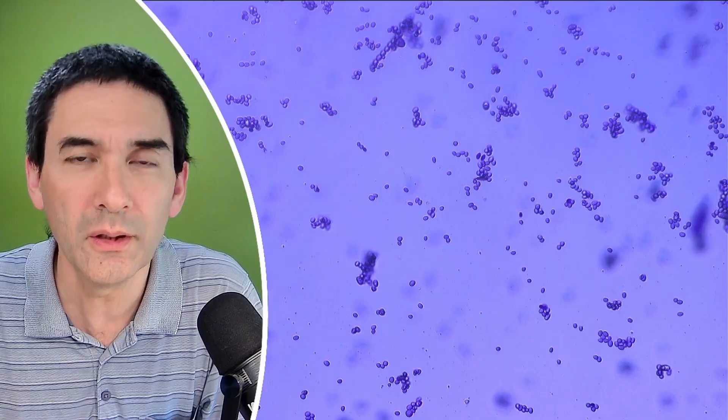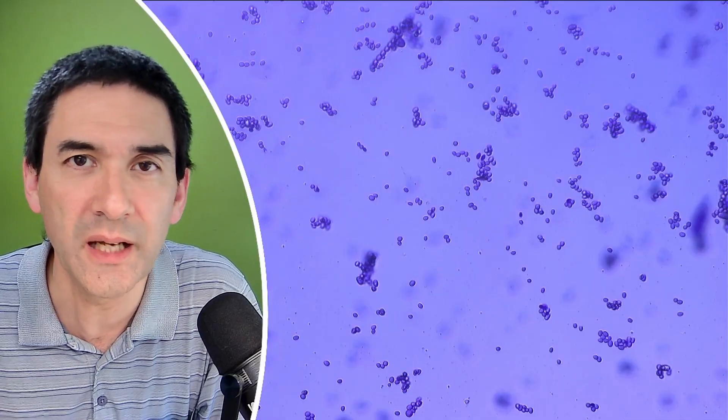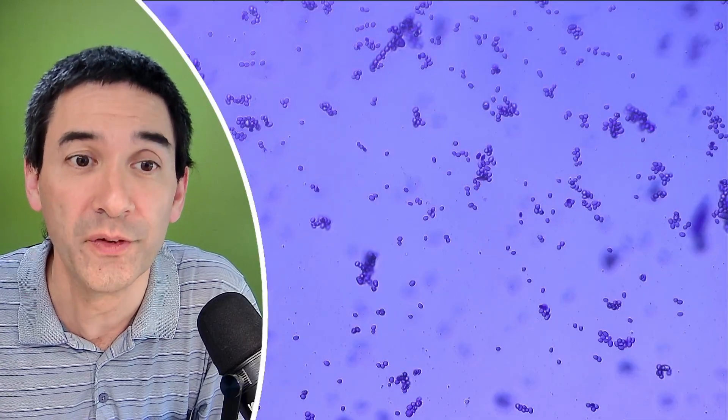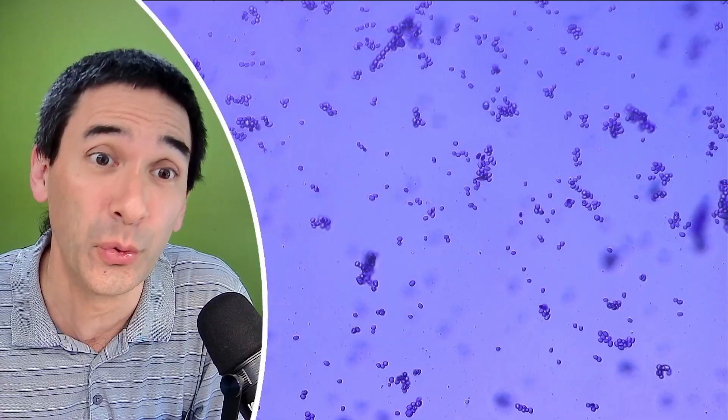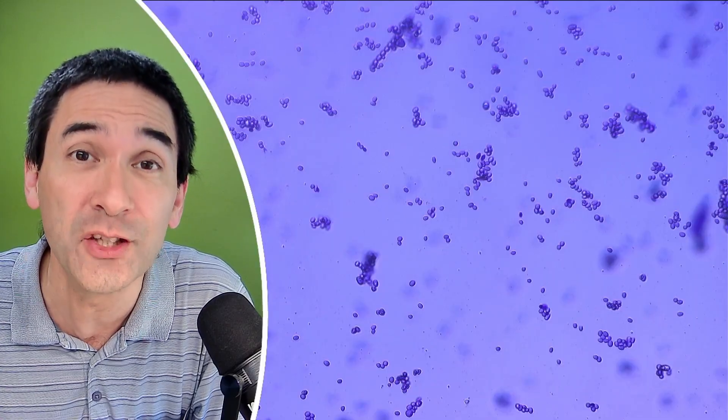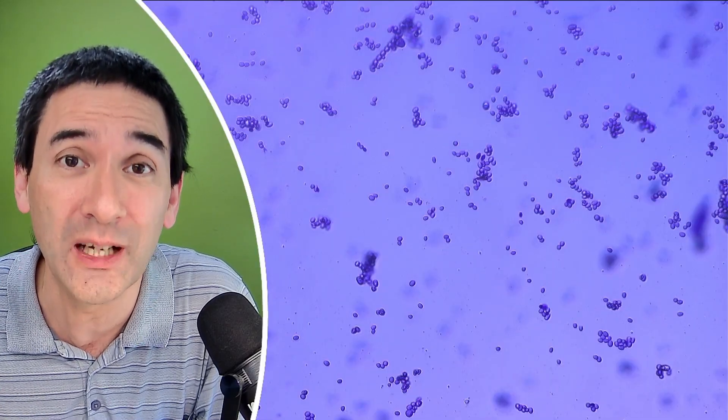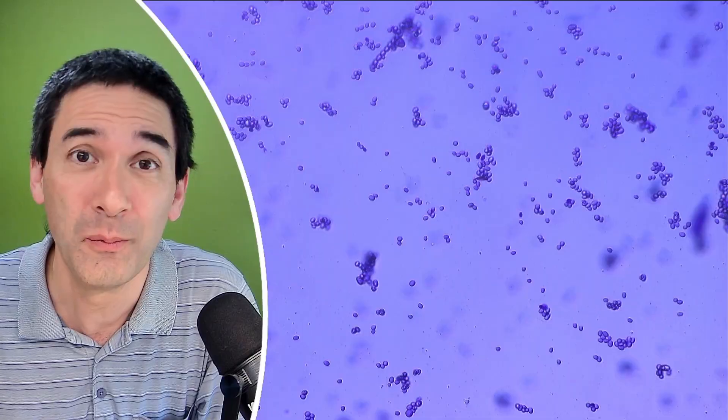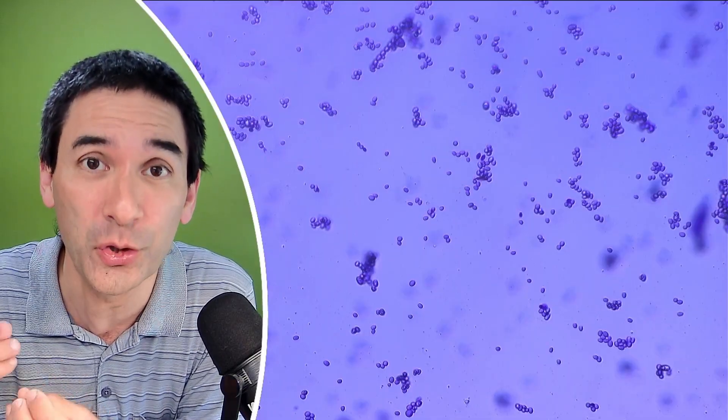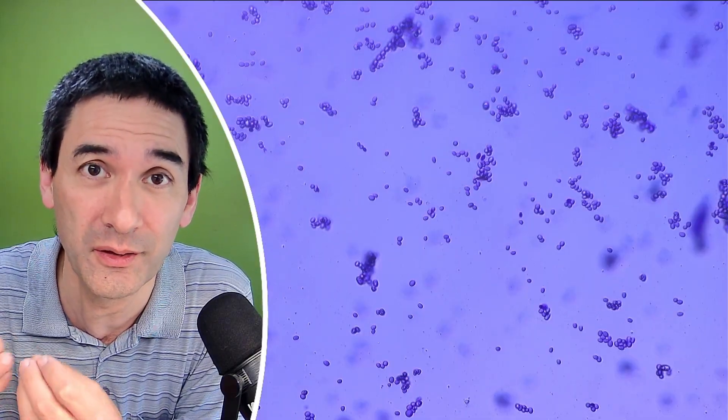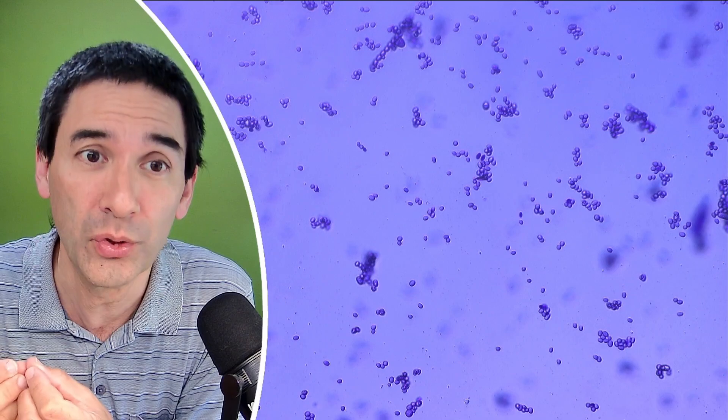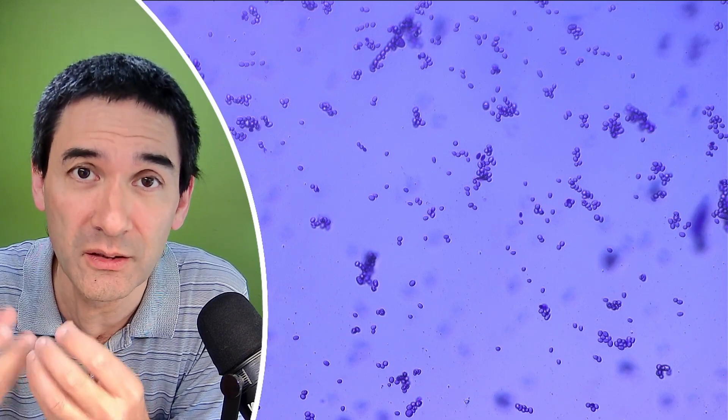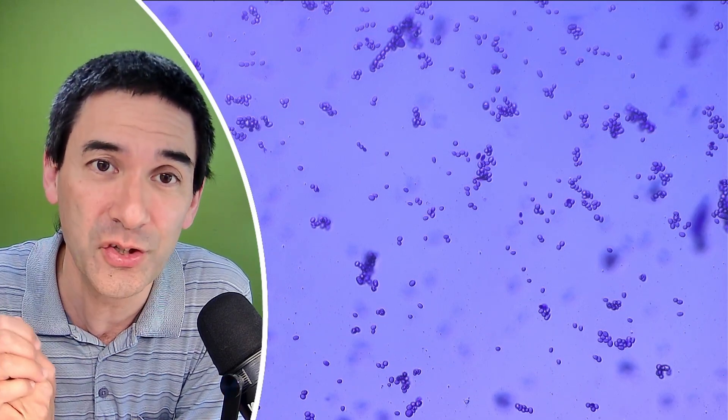And here we are. All those round tiny dots that you see, these are now the spores of the fungus and one of the things that you are going to notice is that they actually stain darker than the surrounding medium. What happens is that the crystal violet starts to react with the material in the spores and it turns them darker than the surrounding medium.